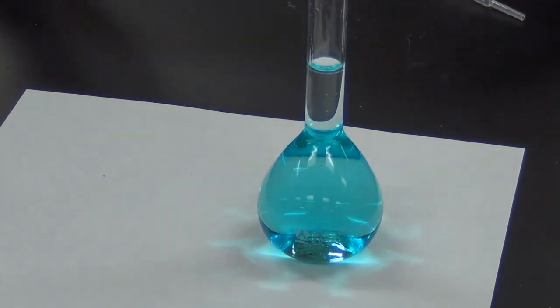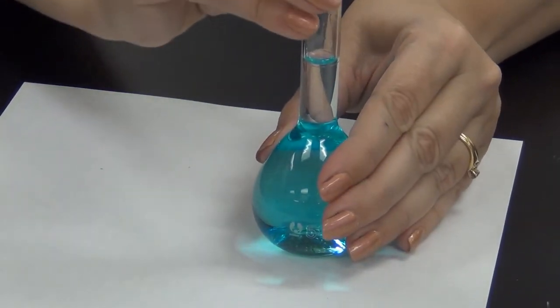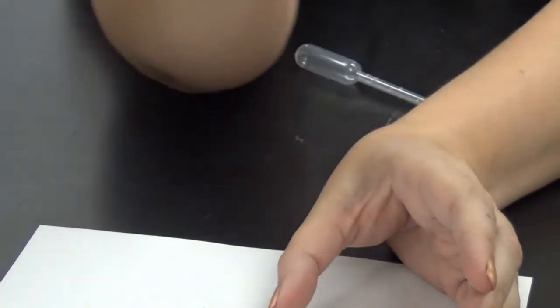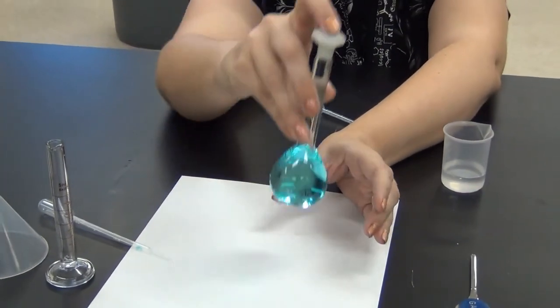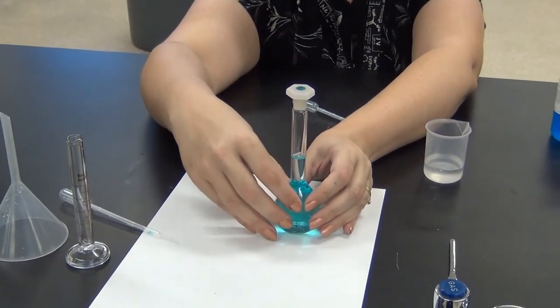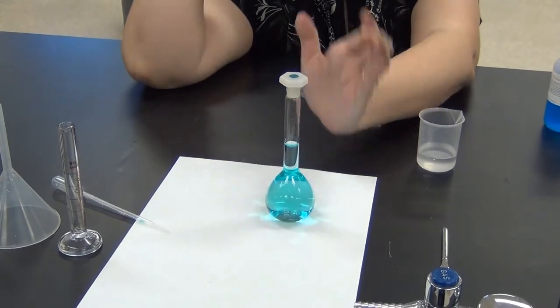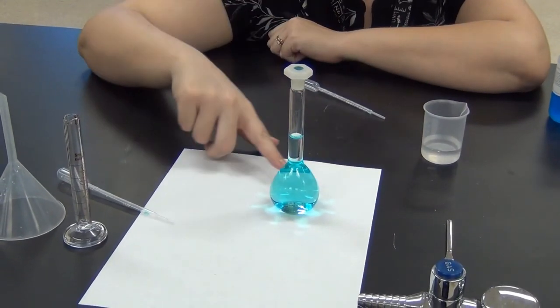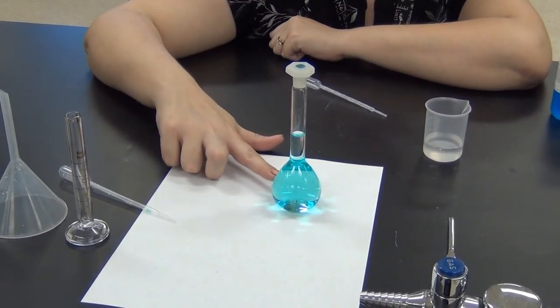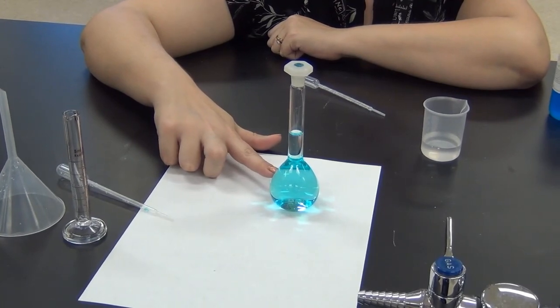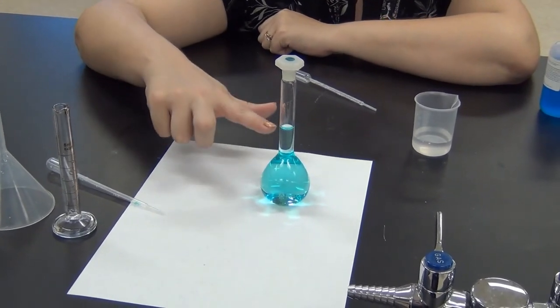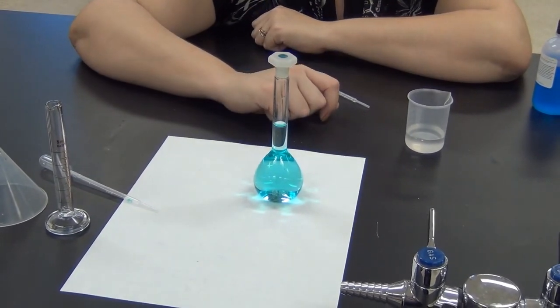Before I use it I would want to cap it and make sure that I invert it gently a couple of times to stir it, to make sure that the solution is homogeneous throughout. It was most likely more concentrated down at the bottom where the solution started than at the top where I'd been adding a great deal of water.